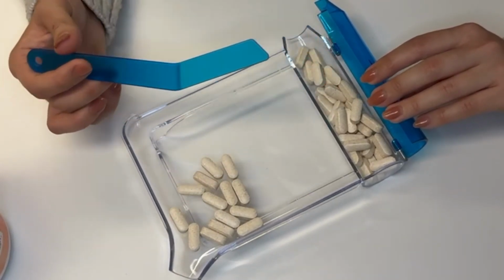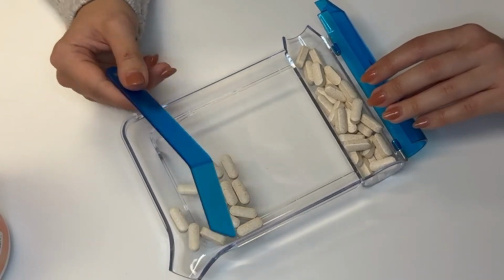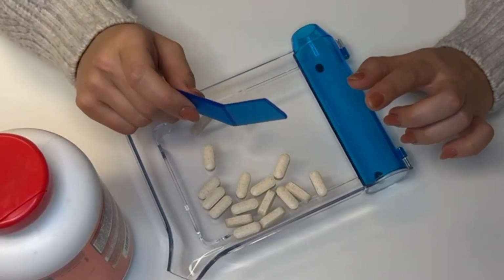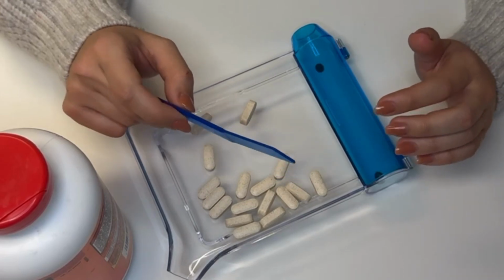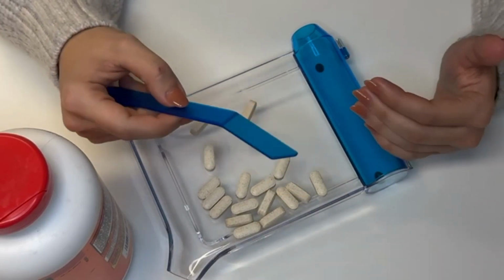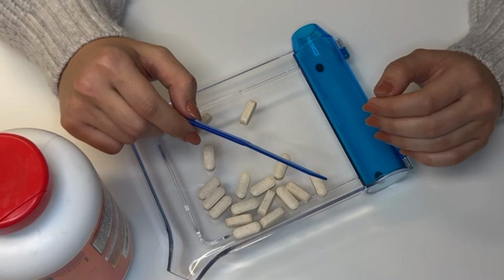For 30 tablets, you can also go with counting 5 tablets at a time. But for example, let's say 180 or 200, you can just make it fast by counting 3. And remember that both methods are valid. Use count by 5 when the pace is comfortable and the quantity is manageable. Use count by 3 when you want a tighter rhythm, when the medication is a capsule, or when you need more speed without losing accuracy, let's say.